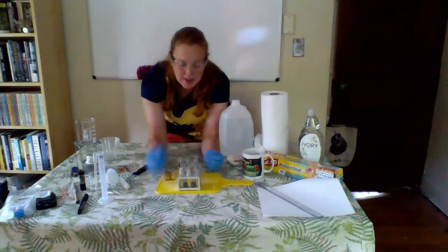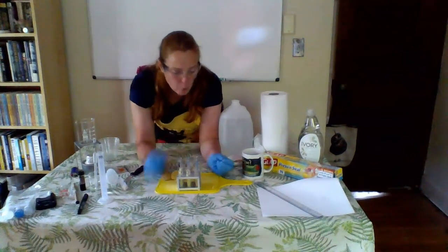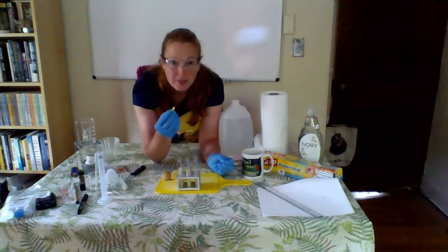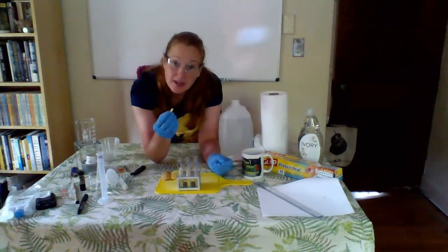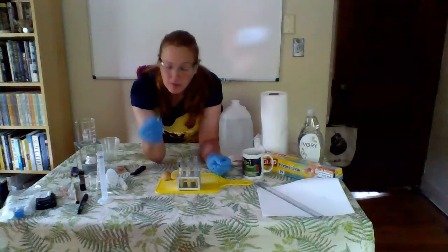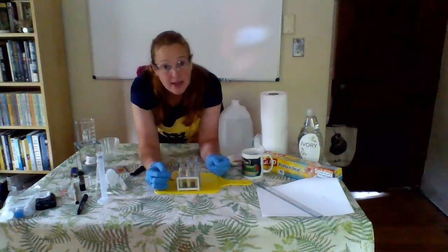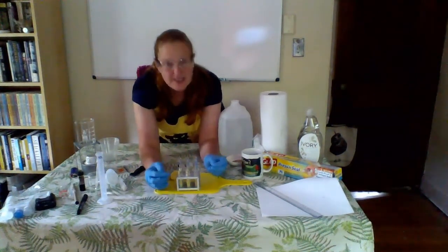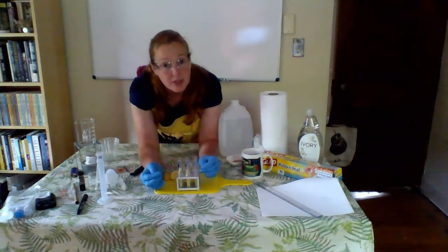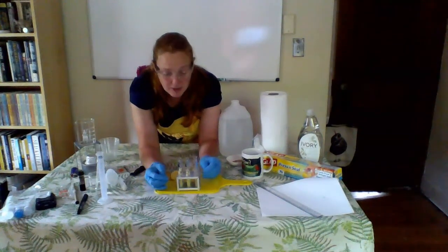So for experiment 1, when you cut apart your potato pieces, one of the things to keep in mind is once you cut apart one potato piece, you may want to use that as a template. So you can cut all of yours. We need 2 potato French fries per tube. You can see I've got my 6 tubes all lined up here, all labeled A, B, C, D, E, F. I've added my different solution amounts, and I've added my 2 little potato chunks.